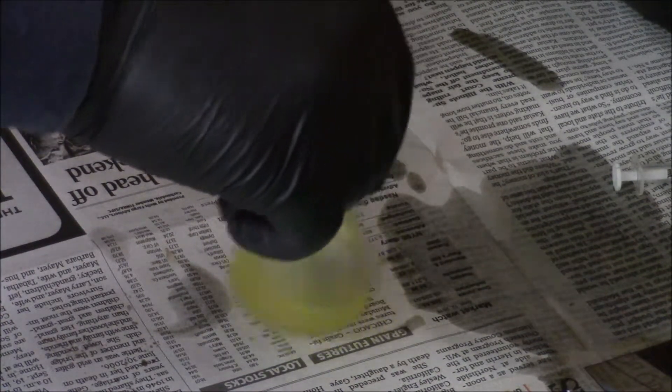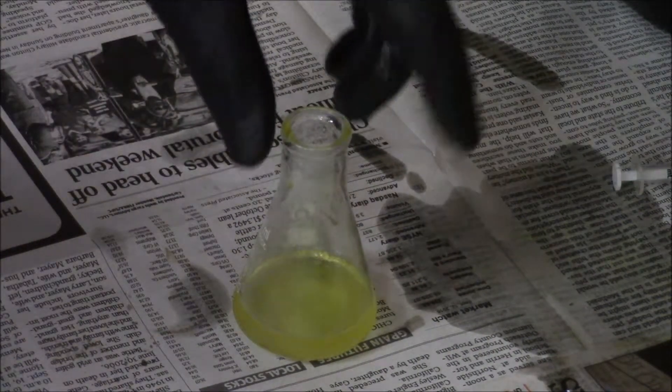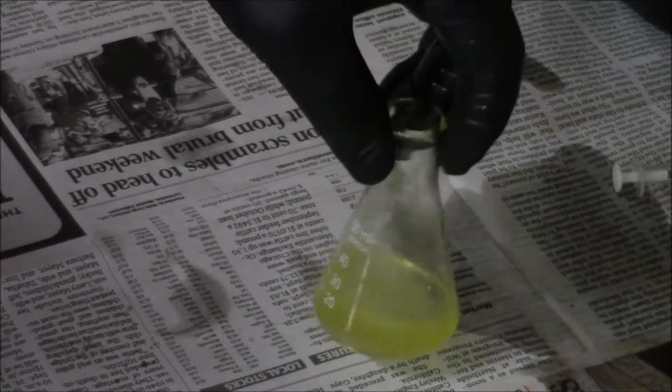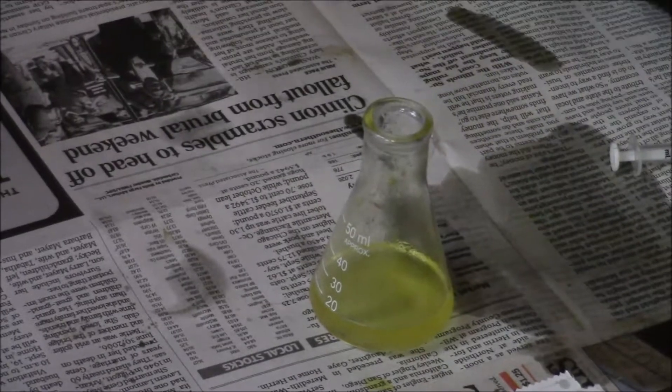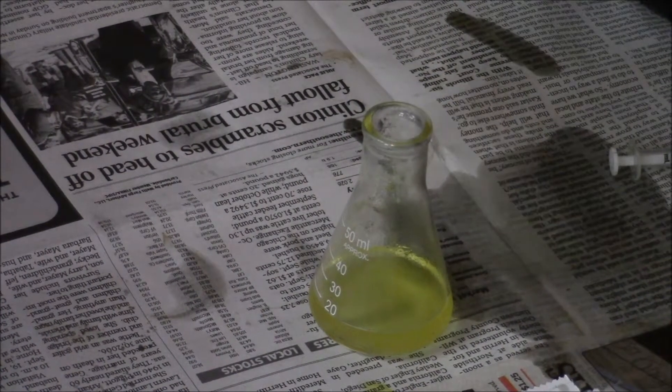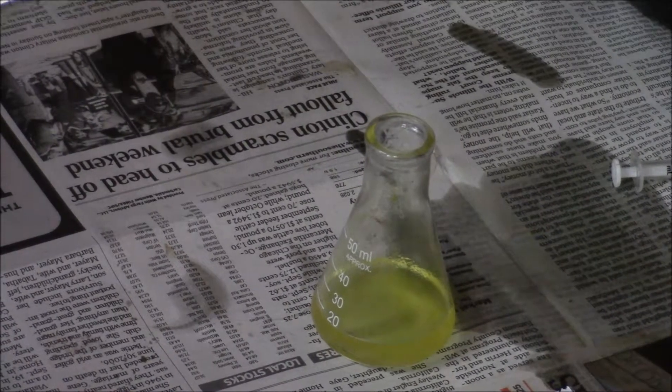Swirl this around a little bit and let the oil dissolve in the isopropyl. Isopropyl is the alcohol that will dissolve oil — methanol will not dissolve the oil; we'll show that when we do a completion test. I'm going to swirl this around and make sure that all the oil is dissolved inside of here. And we are going to add more of the titration solution, which is basic, to our acidic solution.